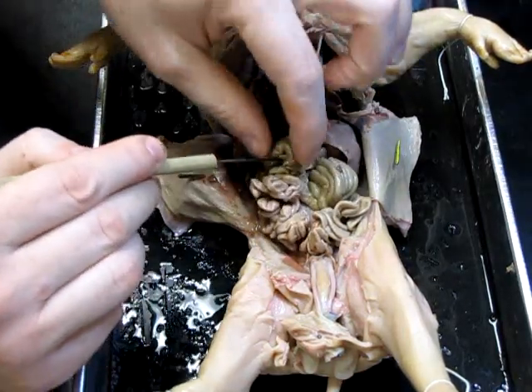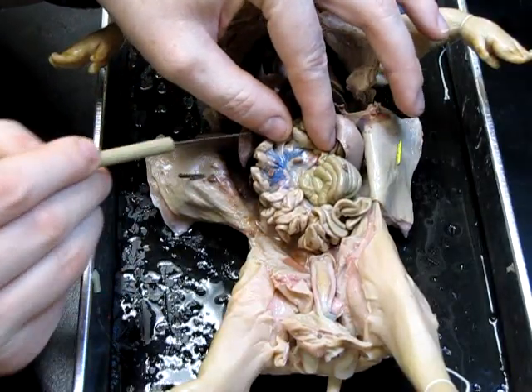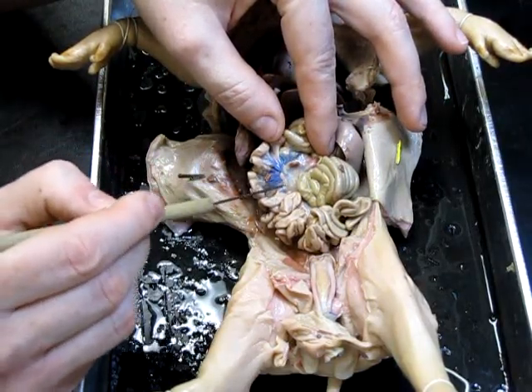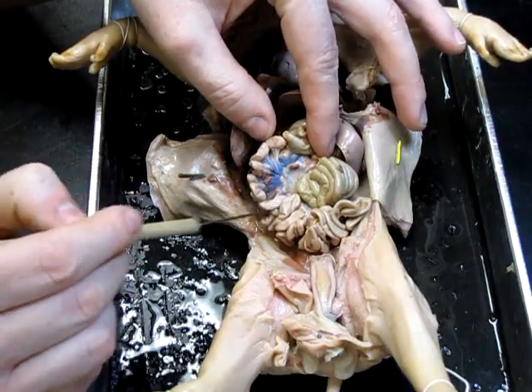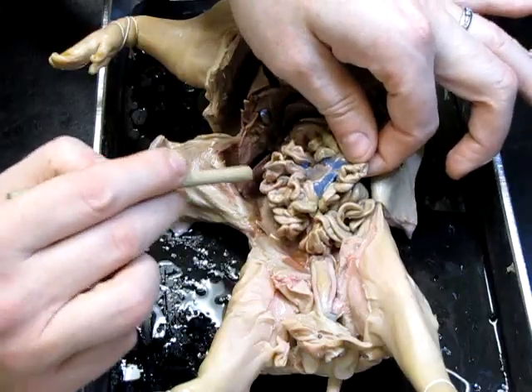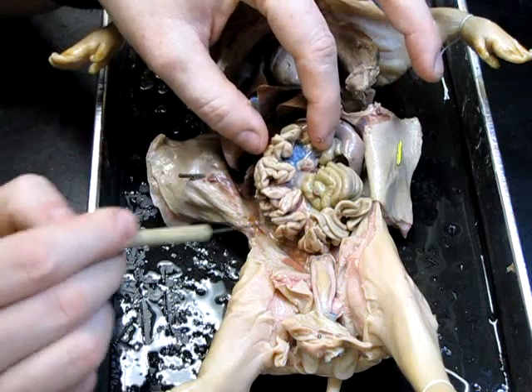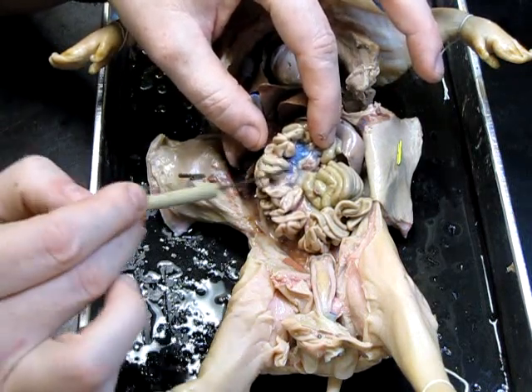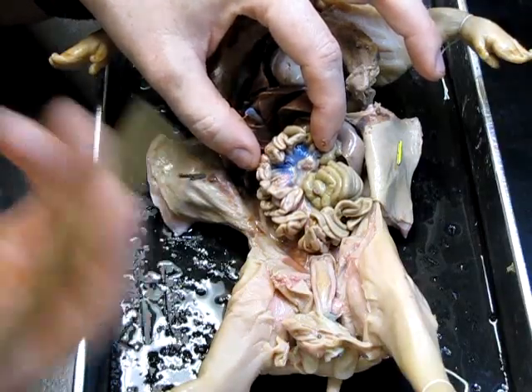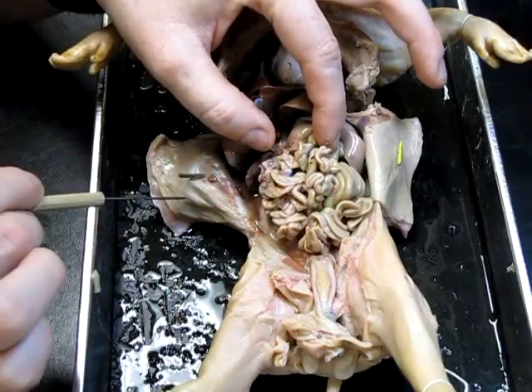While we're talking about the intestine, I will point out the mesentery. This animal has been dye-injected with latex, so you can see where the blood vessels are. Oxygen is able to be sent to the intestines via this mesentery — this membrane which is highly vascularized. Since the small intestine is the site of nutrient absorption, all of these blood vessels are able to absorb and take in the nutrients absorbed through the wall of the small intestine.